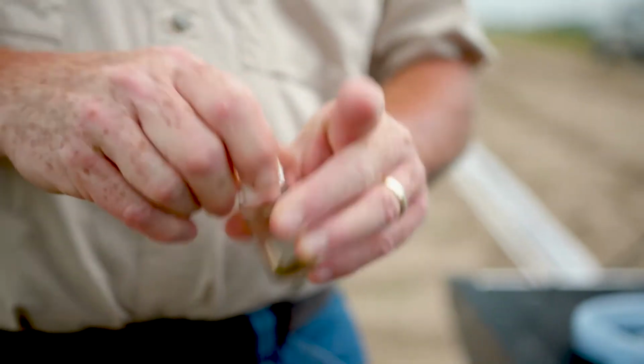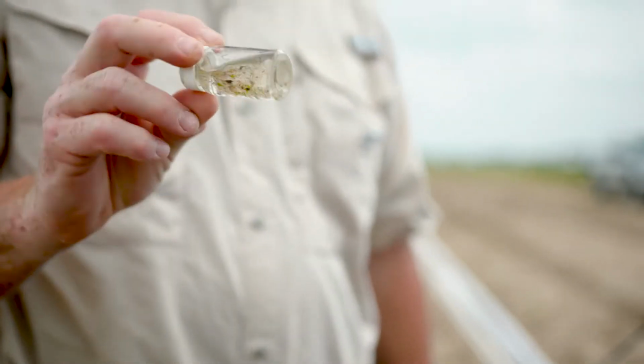There we go, one finished fancy piece of science. So now we'll take this back to the lab, count it under the microscope, identify the thrips, figure out how many adults and immatures are present, whether reproduction is occurring in the plot and at what level.